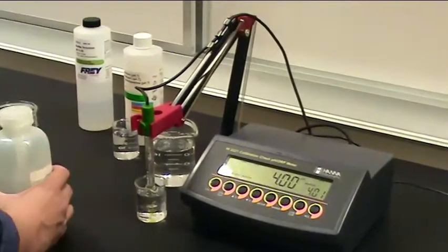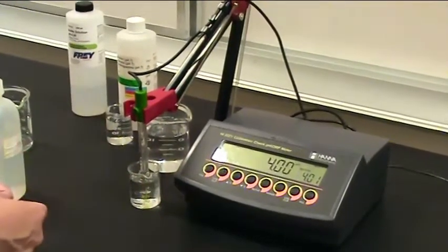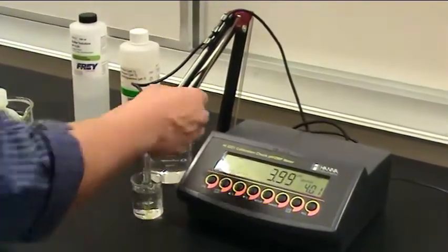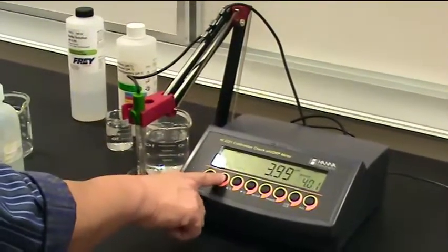And now it's going to expect the next point of calibration with pH 10. If you have the pH 10 buffer, you proceed at that point. Here then, we can just go ahead and hit the calibration button to end the calibration process.